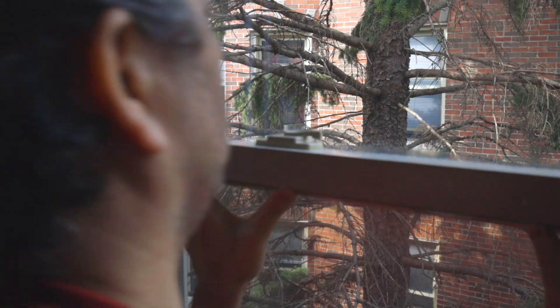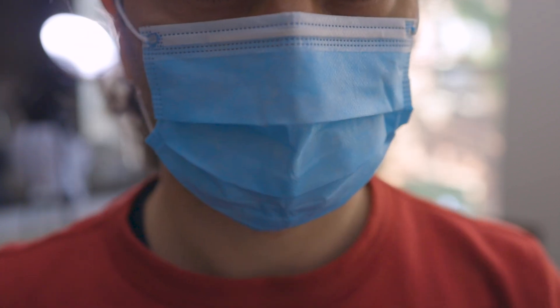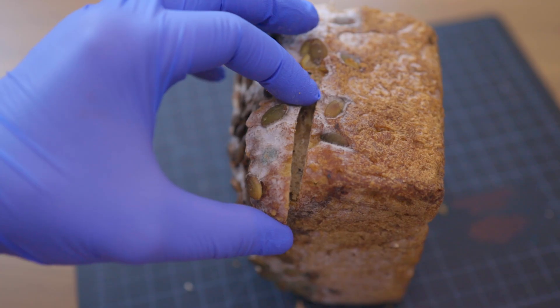I have to open windows and wear protective gear. Inhaling the spores can cause respiratory illness. I'm looking for a greenish-black patch where the spores are ready to fly.